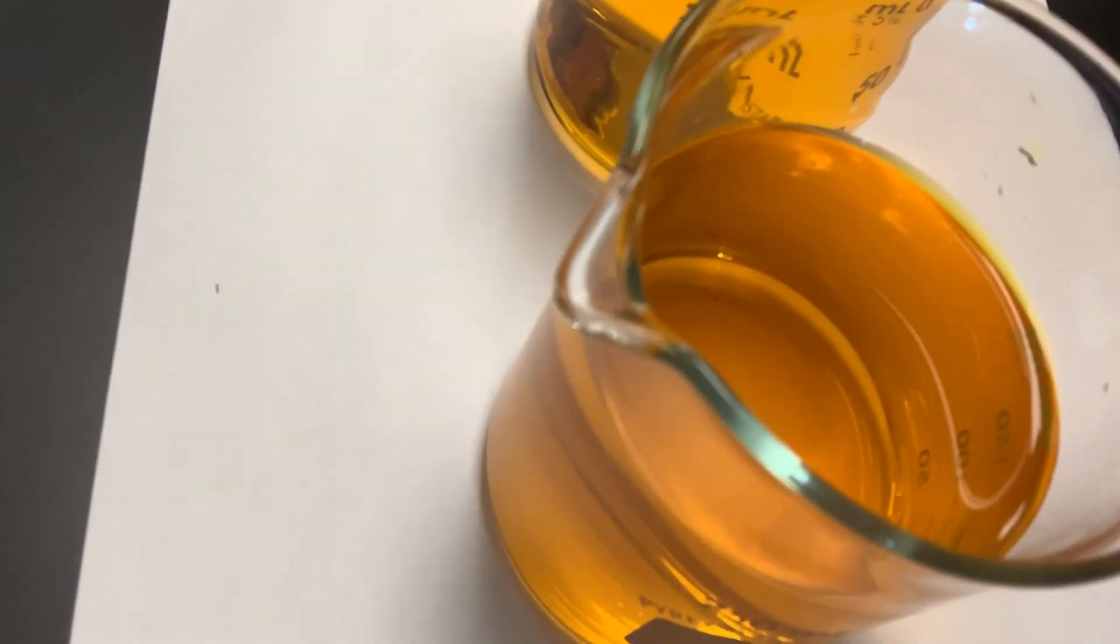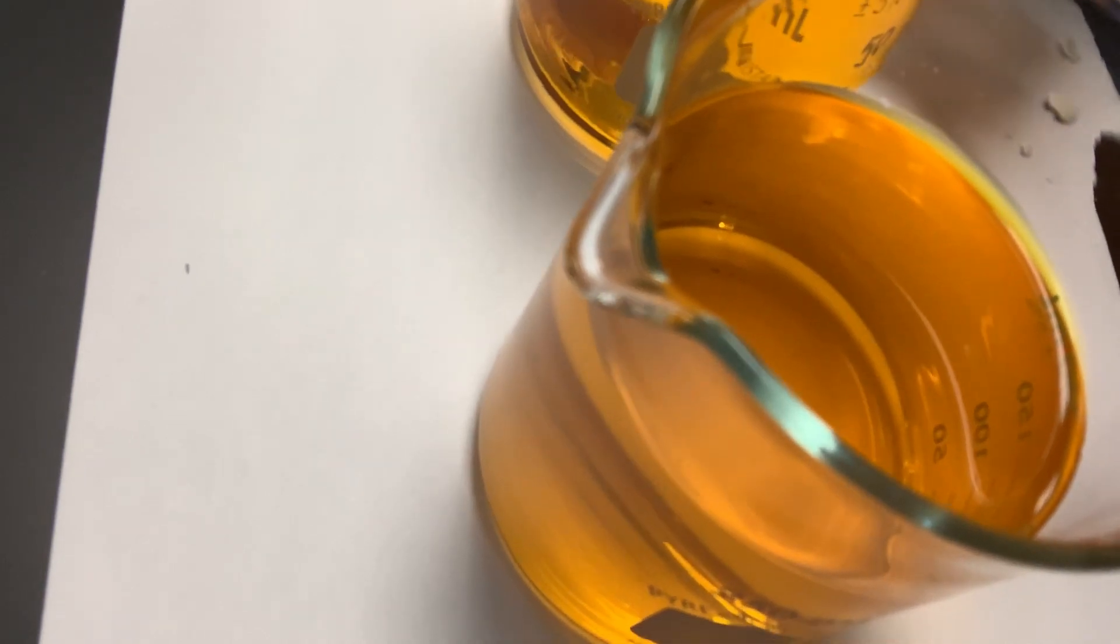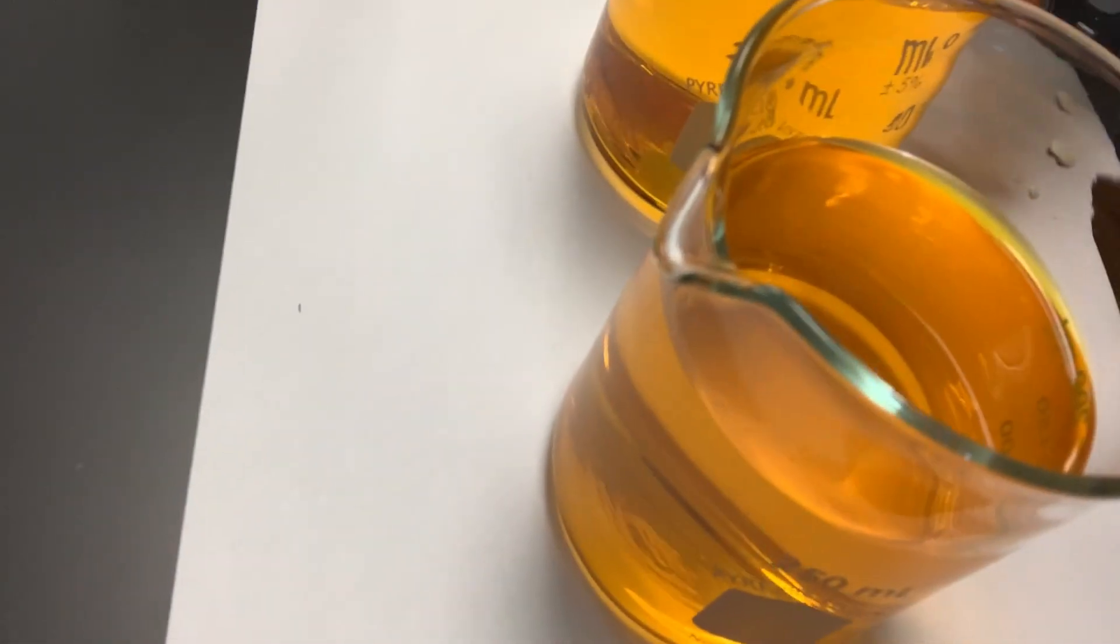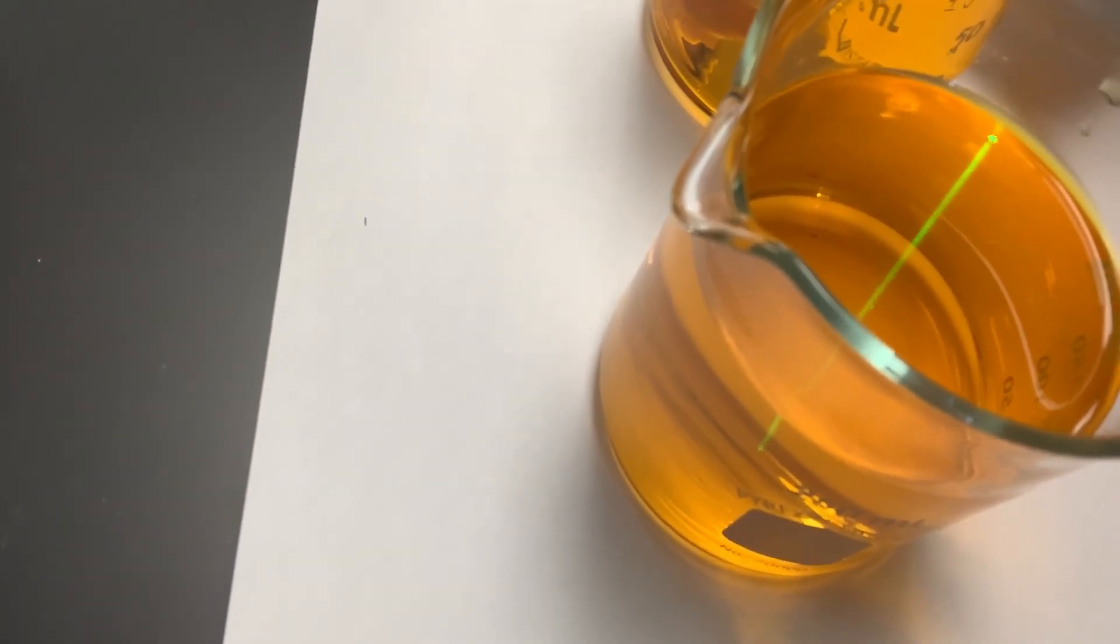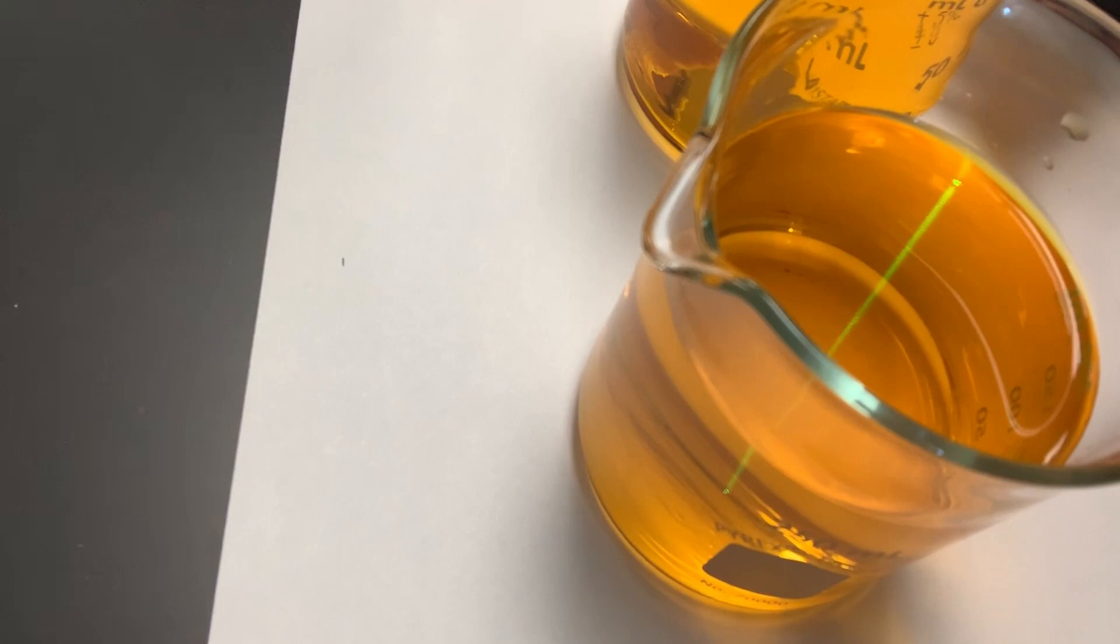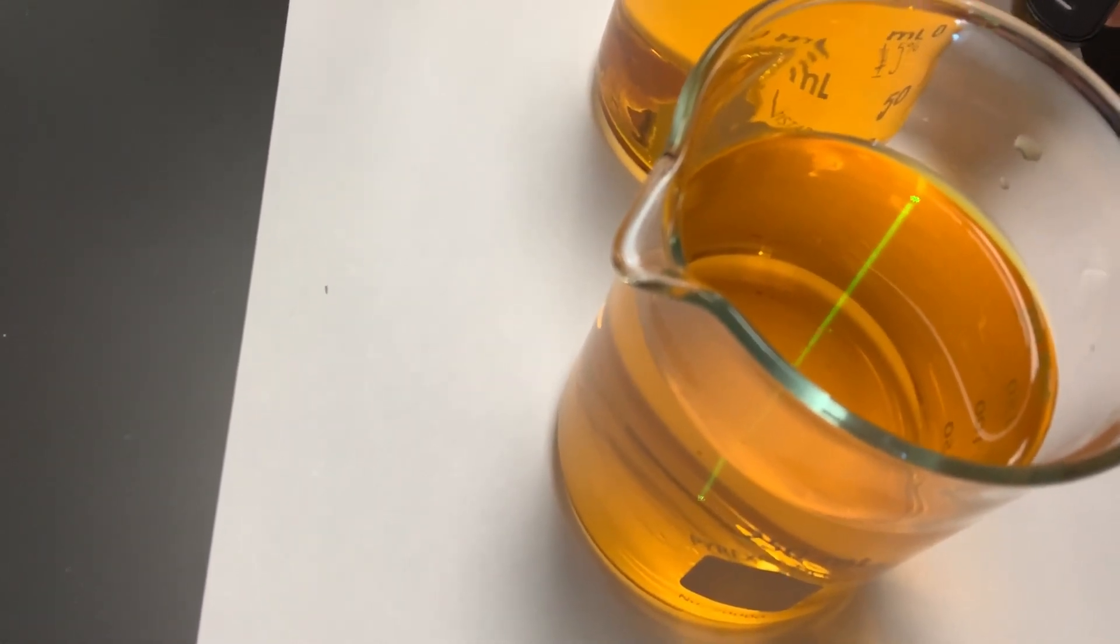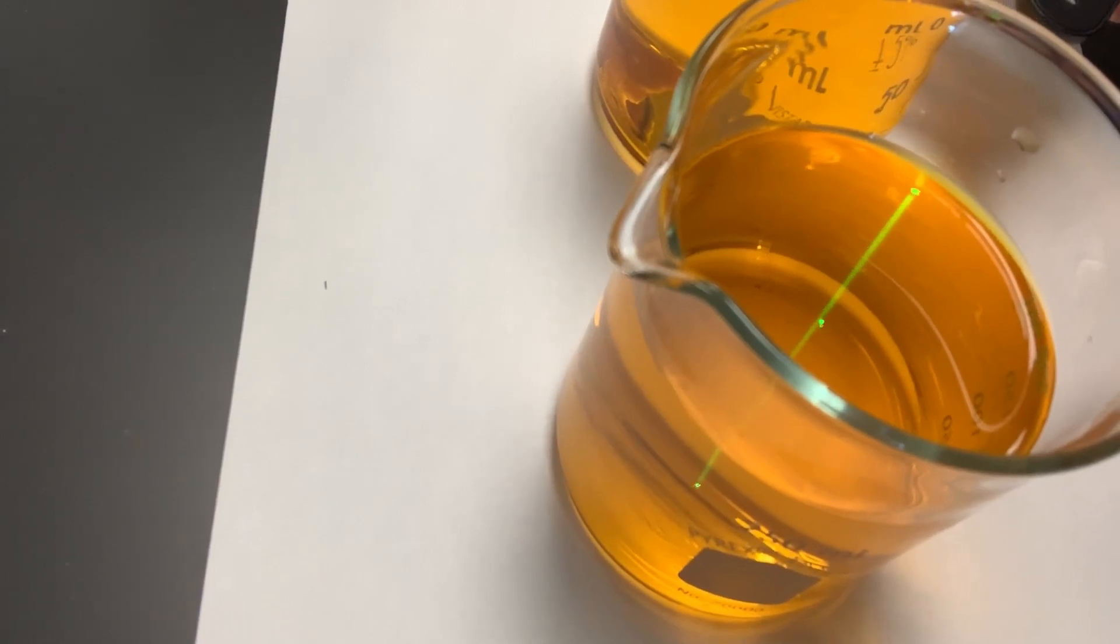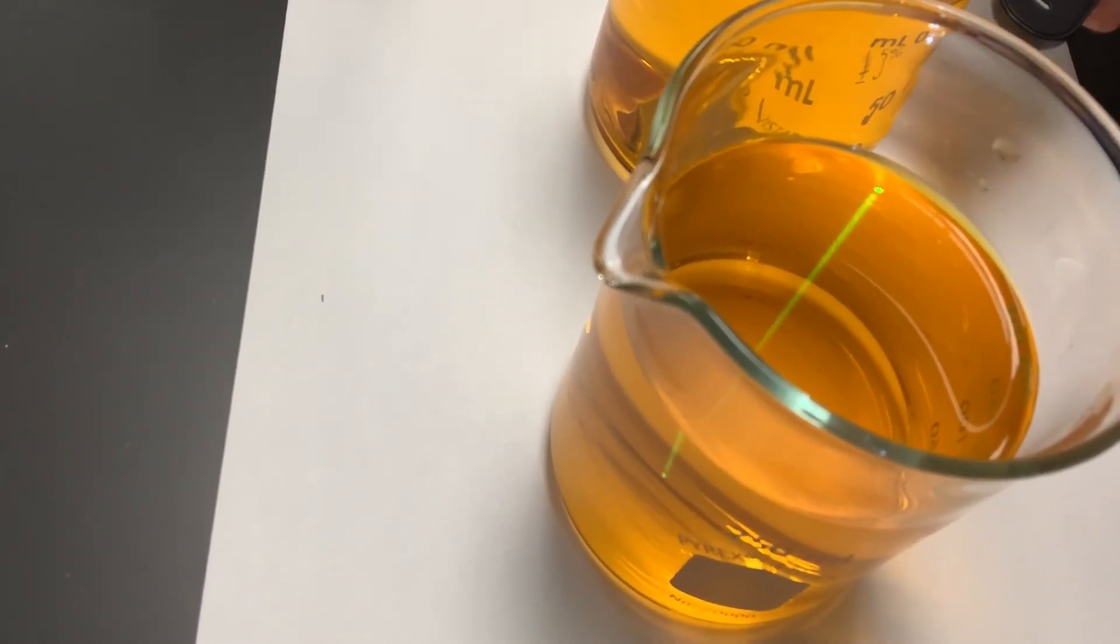Here is my heterogeneous mixture now because there's a solid suspended in the water that we really can't see any longer. And my laser light is now turned on. And can you see the beam passing through there now? That's a positive Tyndall effect. It's reflecting off of those small particles that are suspended in that mixture, showing that it's heterogeneous. There's more than one phase in there now. Not homogenous.